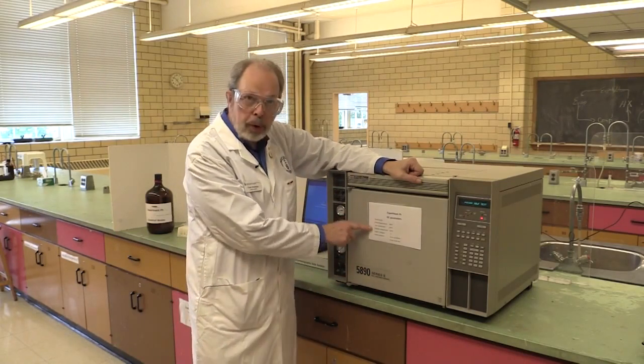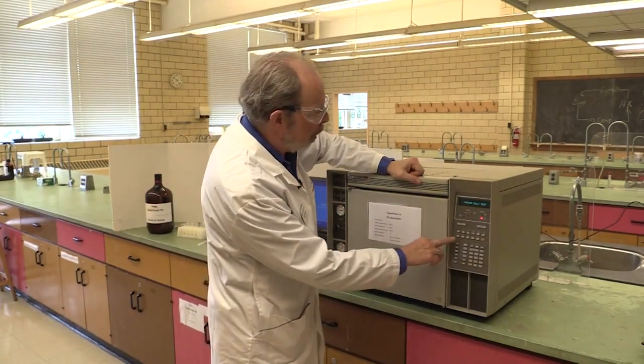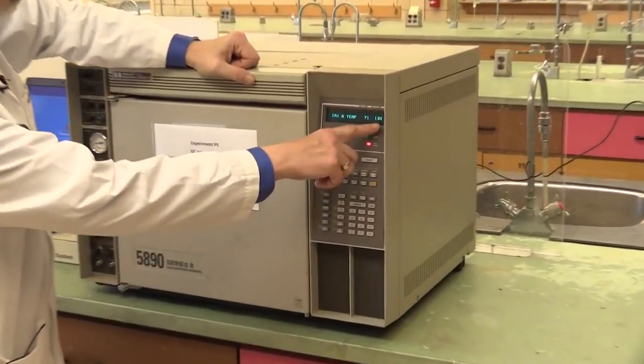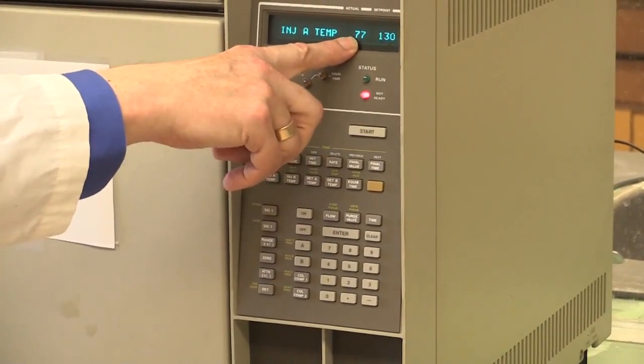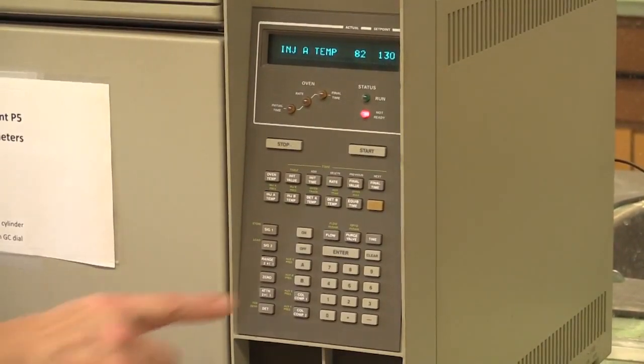Check the injector temperature on this button here. It's set to 130, and it's warming up now. It's at 74, 75, 76. That will equilibrate at 130 very shortly.